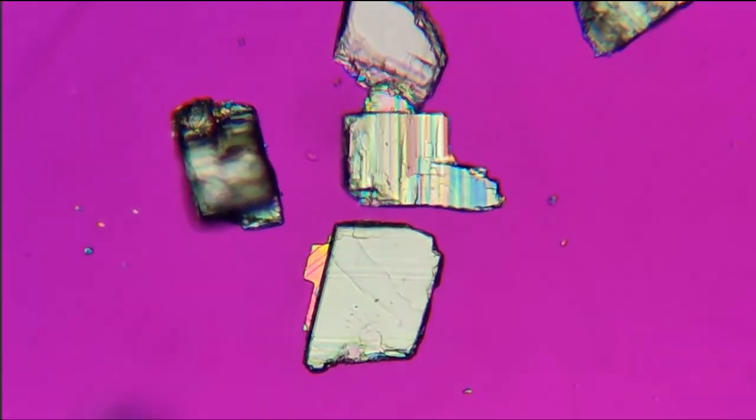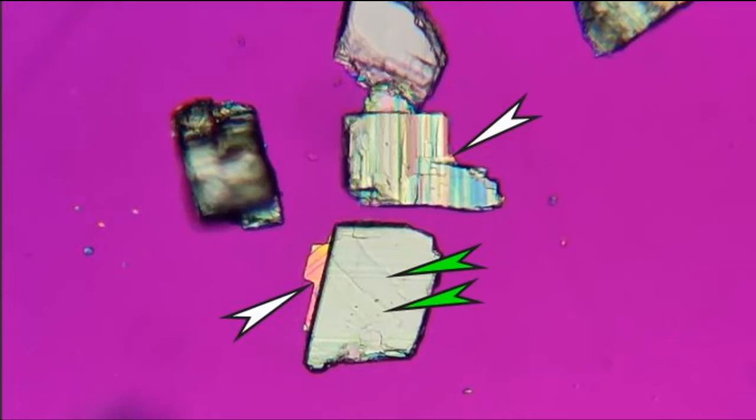The next thing to be aware of is that calcite has perfect cleavage in three directions and will generally yield a rhombohedral crystal. In the right orientation, these crystals can appear cubic. Now, that doesn't necessarily mean you're going to find a bunch of perfect little rhombohedrons, especially considering calcite also contains curved crystal faces. And it's these curved crystal faces that yield conchoidal fractures and also give some of the grains the appearance of lamellar sheets.